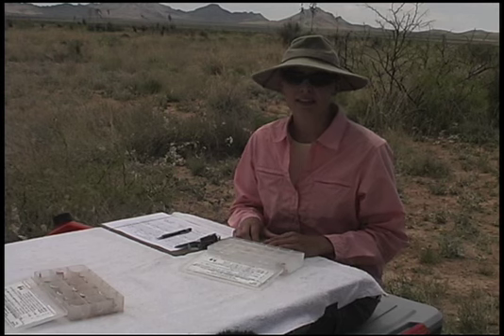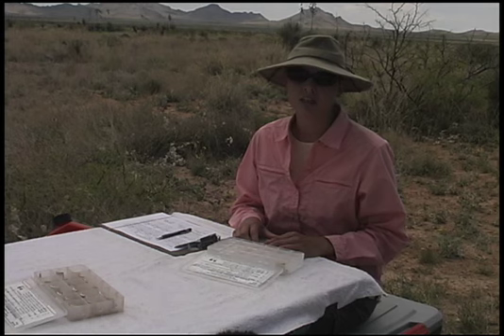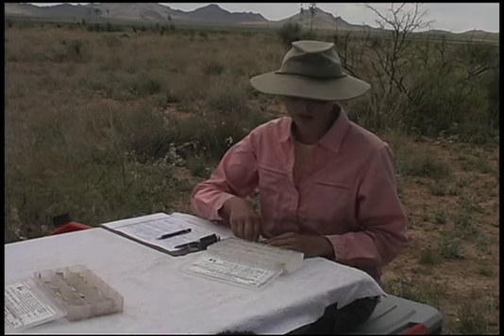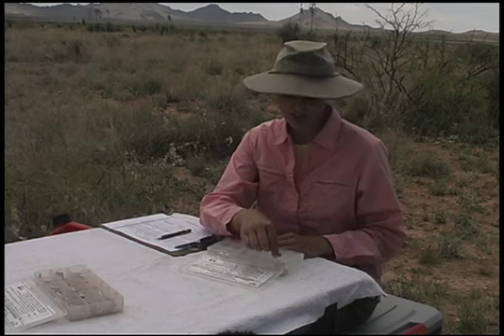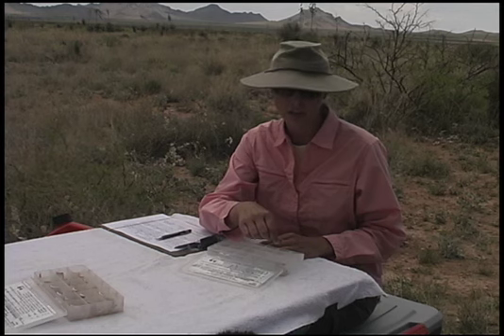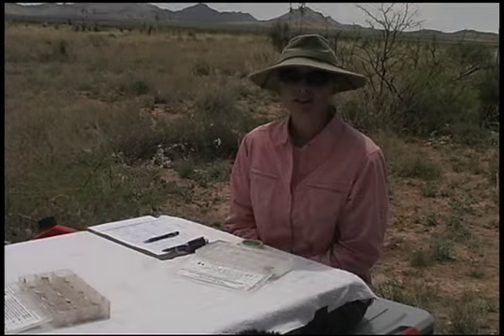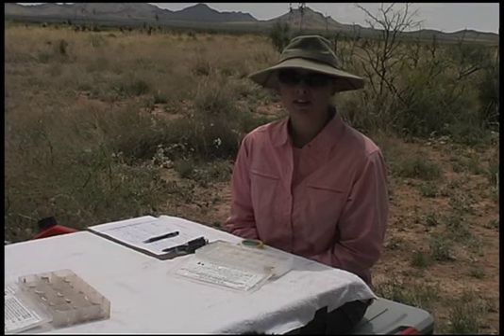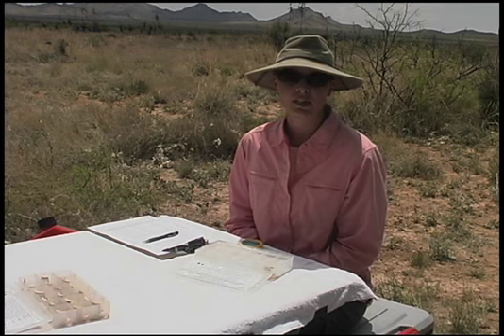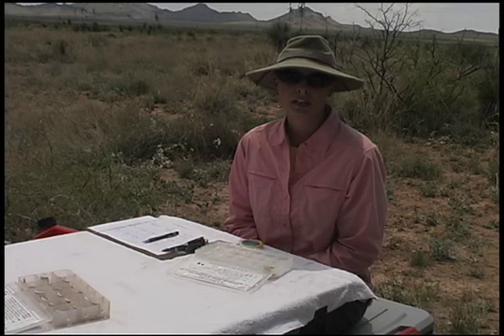At 5 minutes, regardless of whether the samples have been rated a 1, 2, or 3, all of the samples must be dipped. The rate of the dipping is very important. It should take 1 second for the sieve to come out of the box and clear the water, and 1 second to go back just above the bottom of the cell. After 5 dipping cycles, if 10 to 25% of the soil remains on the sieve, it is a class 4. If 25 to 75% remains, it is a class 5. And if 75 to 100% remains, it is a class 6.